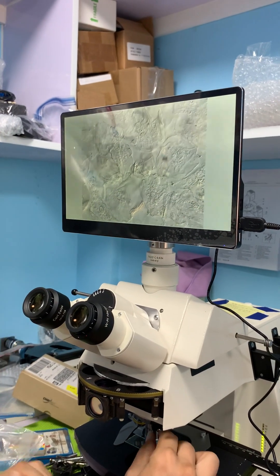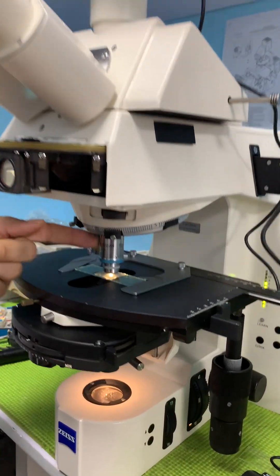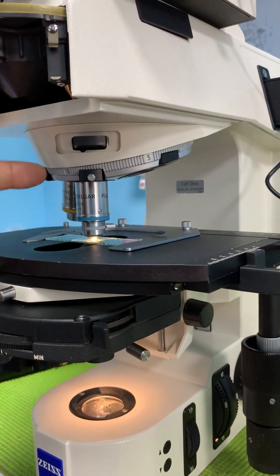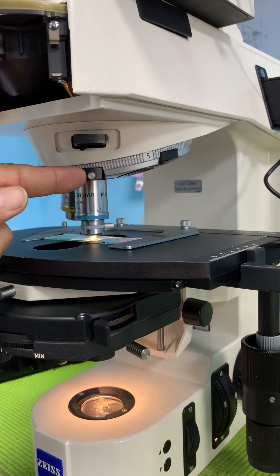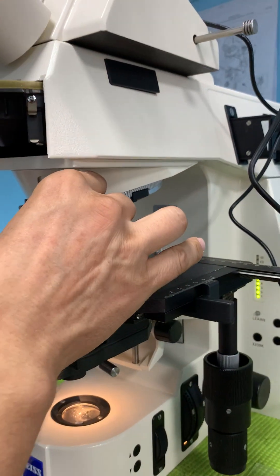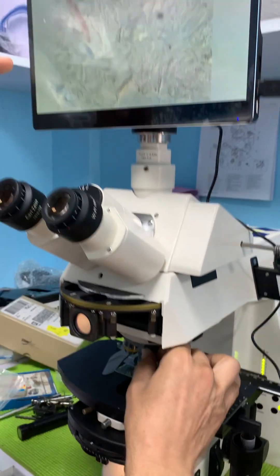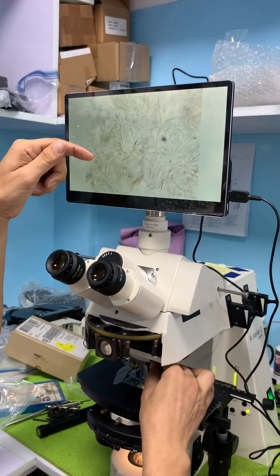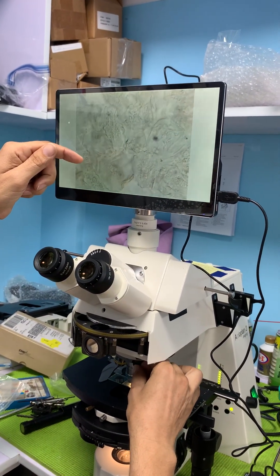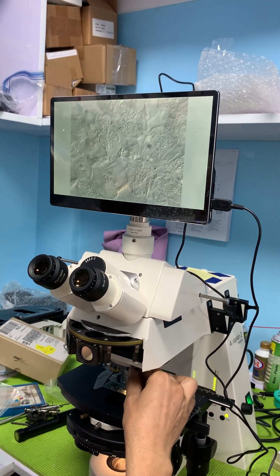We're on a Plan Neofluor 40x, and here's the DIC prism for the objective. Watch what happens as I rotate it — it'll go from a positive bias to a negative bias.